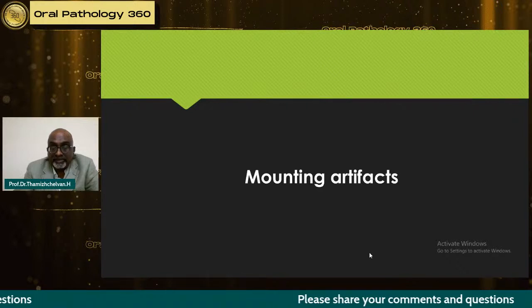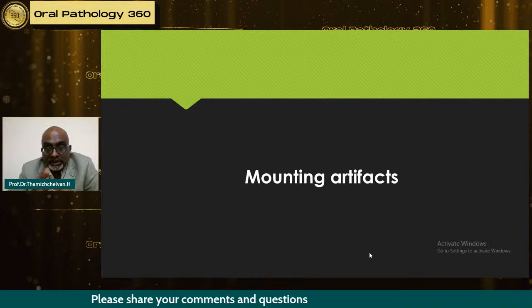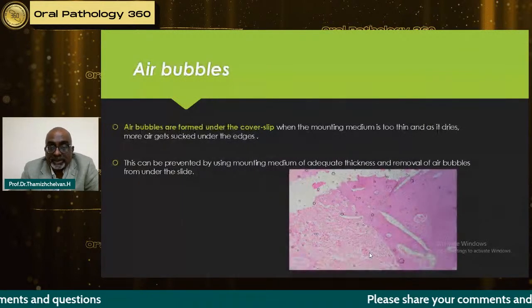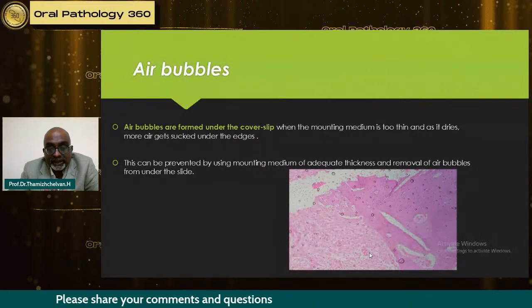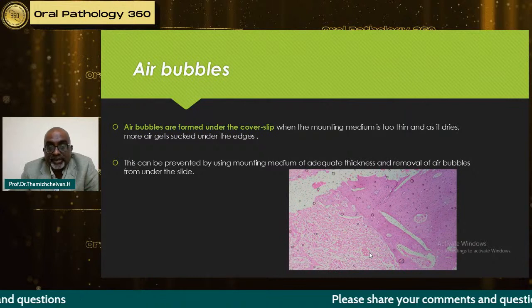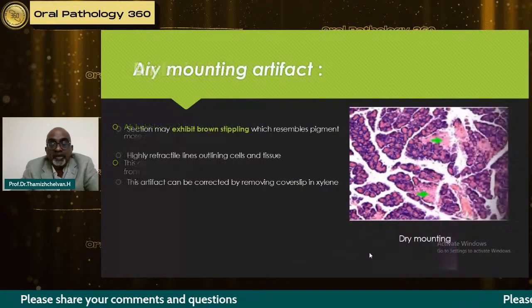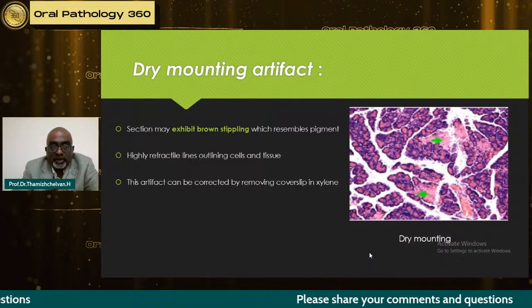Then comes the mounting artifact. It's 3:45. The technicians have to go because the bus is at 4 o'clock. The problem starts here. They trap air bubbles under the cover slip, and the mounting medium is too thin or dry, or they dry too much and then try to put on a slide. So that is the cause of all these air bubbles. These can be prevented by using mounting media of adequate thickness and removing the excess from under the slide. What I'm saying is, it happens in our day-to-day practice, but these can be avoided.